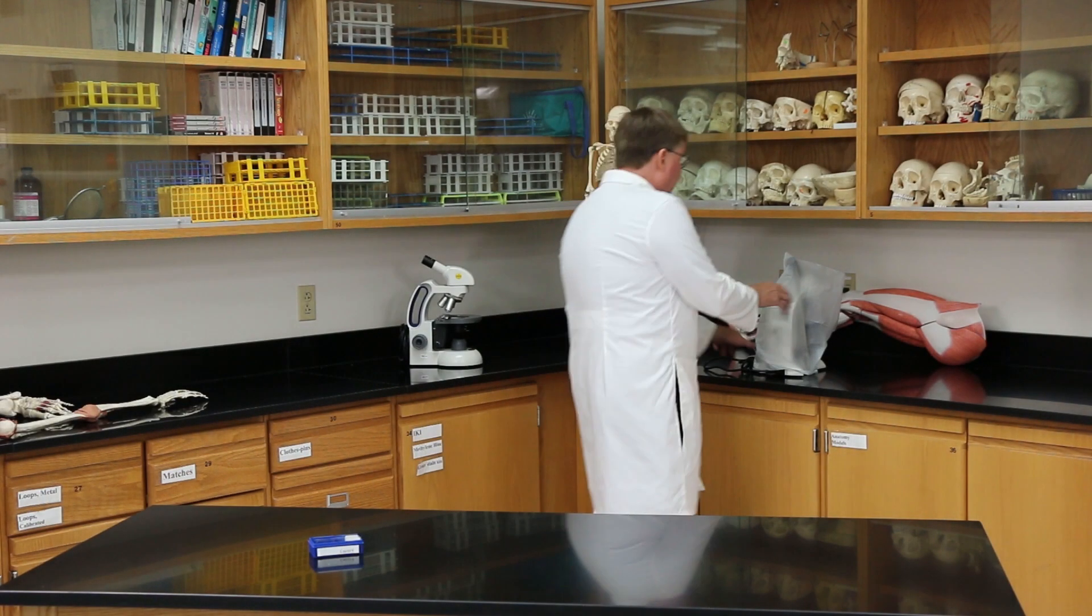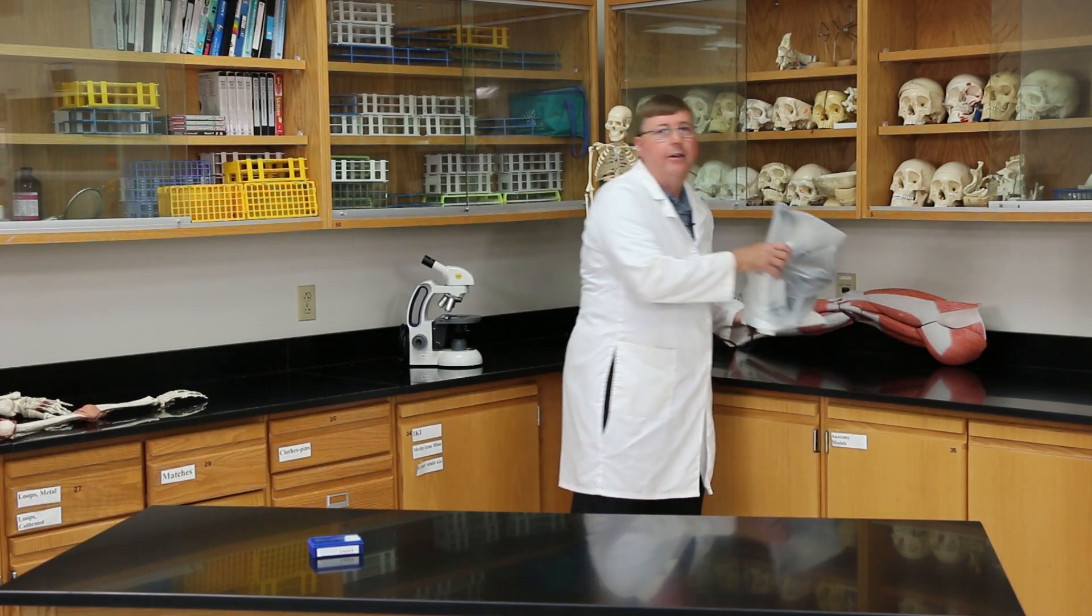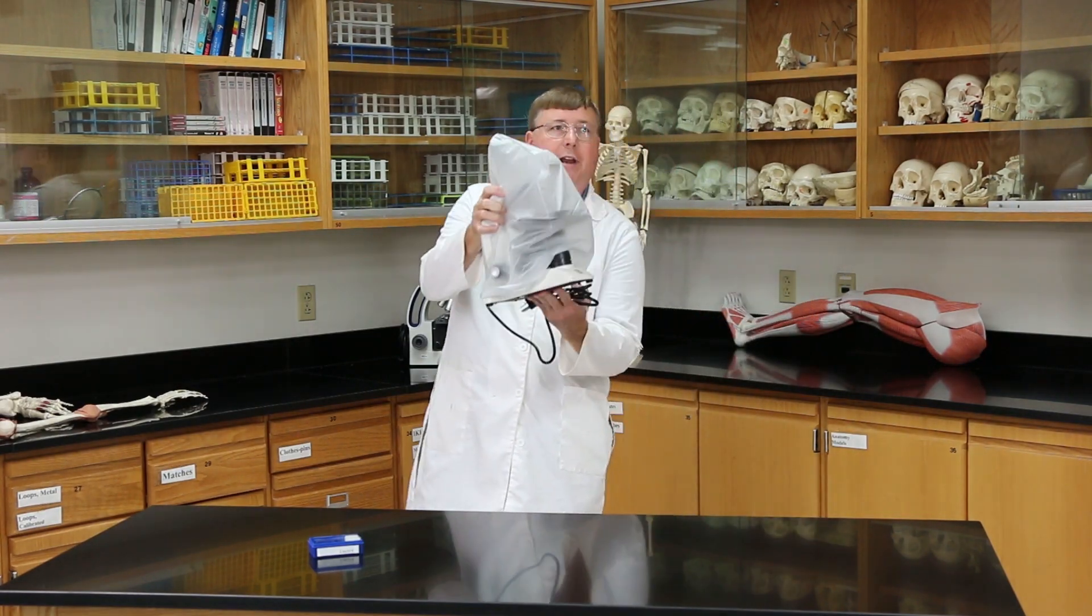When you pick up a microscope, use two hands, one around the arm and one under the base, and then carry it to your table and gently set it down.